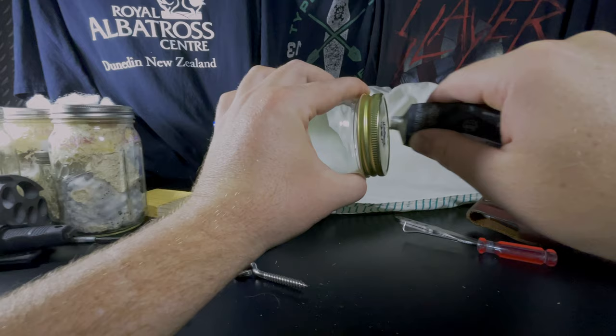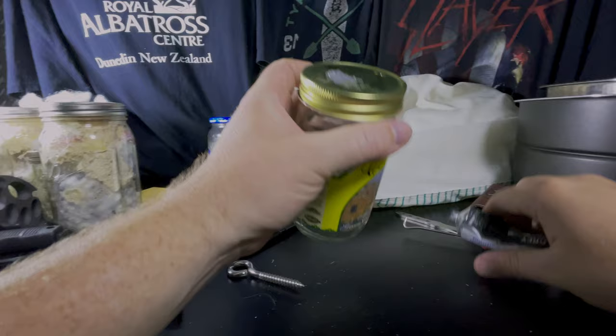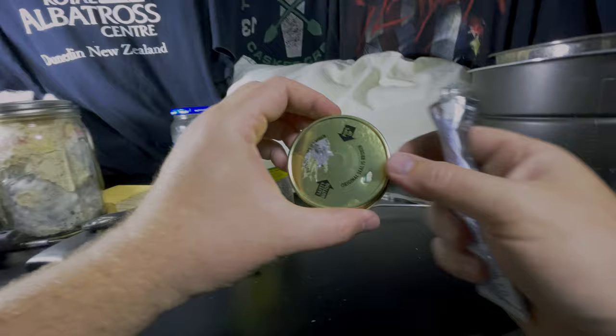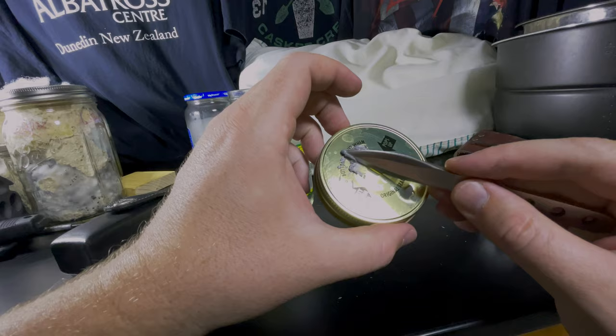I think there was a dried surface, so it didn't really stick. And if you want to, you can go on the inside of the jar and put another little bump. So then it's got like continuous, once this is dry. If you want to scrape off some excess while it's still wet, that's a great time.